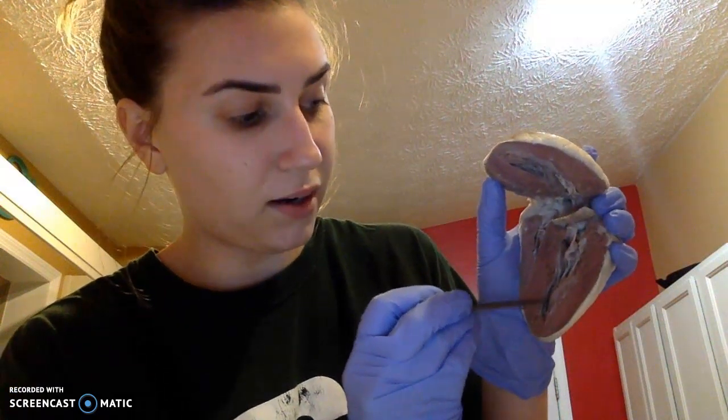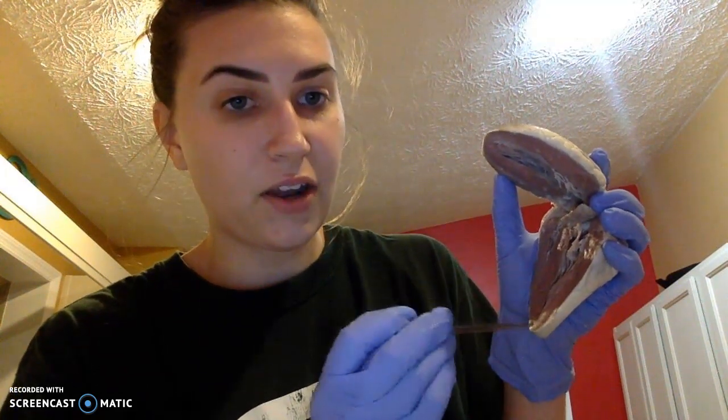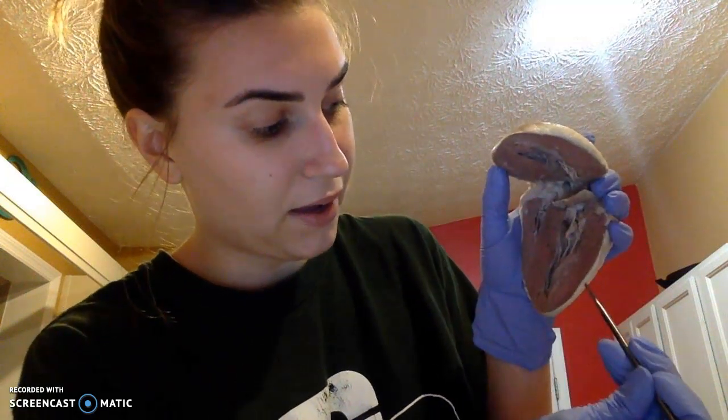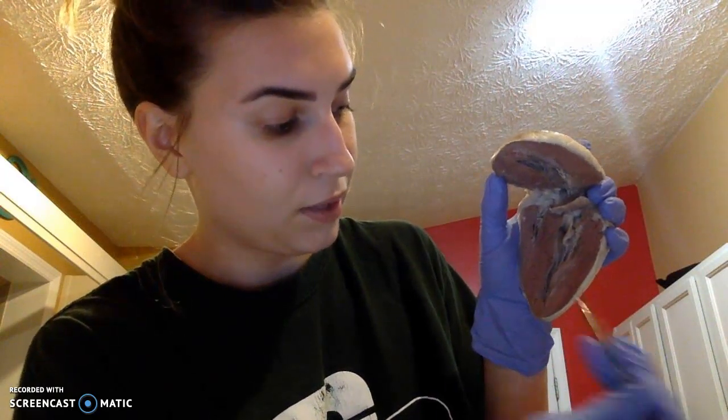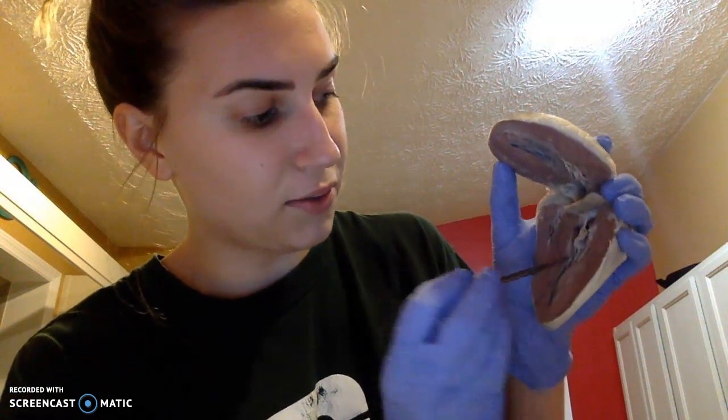Next we're going to have our endocardium, which is the more inner portion of the heart. So this portion right here. Then our myocardium is going to be our muscular layer. So any portion like this can also contract and relax the heart muscle. And then our epicardium is going to be this outer membrane right here, just outside the myocardium. So endocardium, myocardium, epicardium.